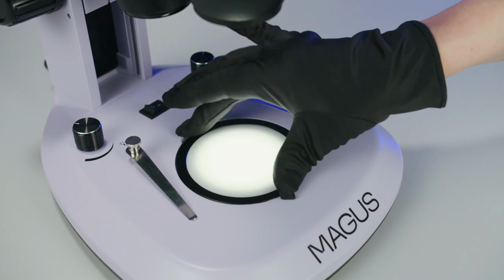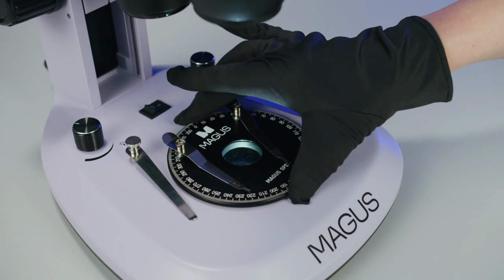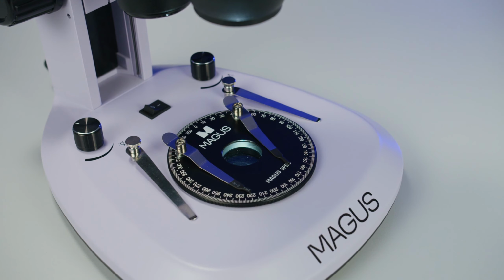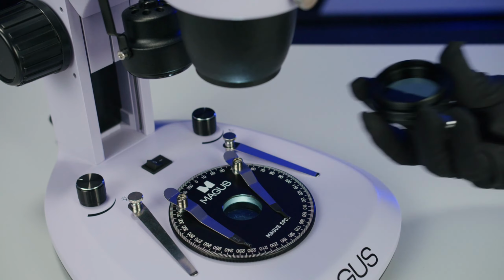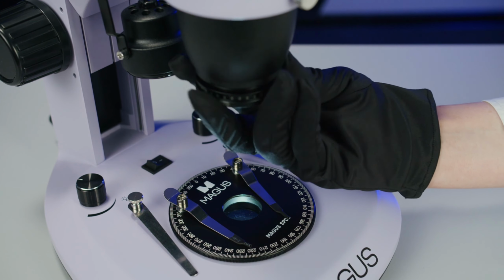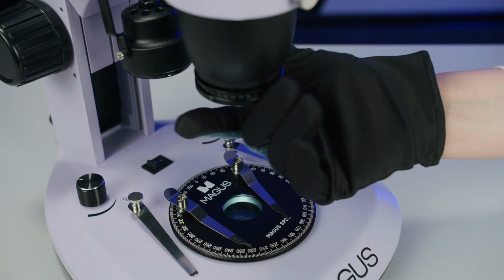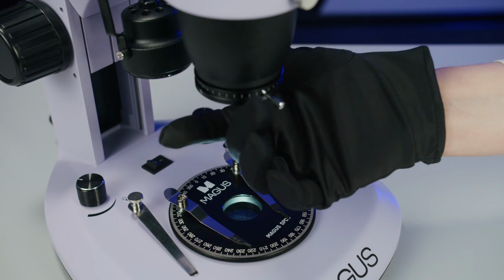The polarizer is installed at the base of the microscope above the transmitted light source. It only allows waves oscillating in a specified plane to pass through. The analyzer is placed after the specimen. It is screwed onto the cover of the objective part. The analyzer detects how the direction of light polarization has changed after passing through the sample.